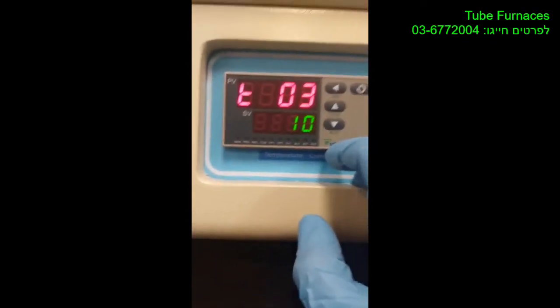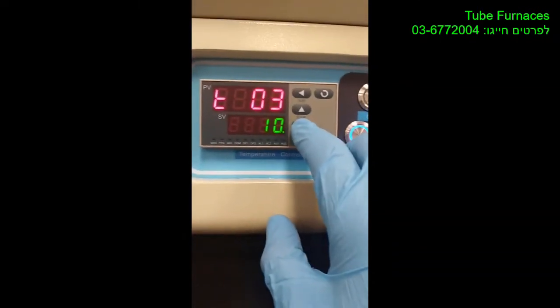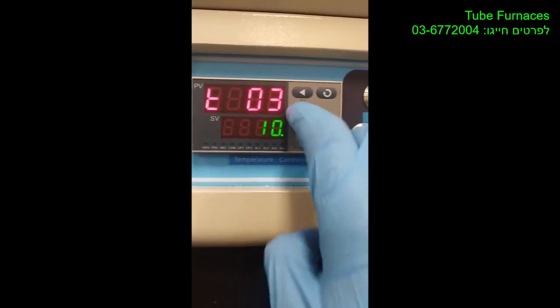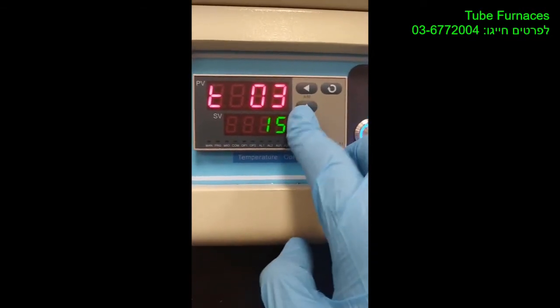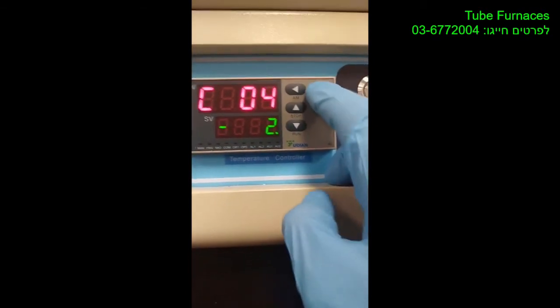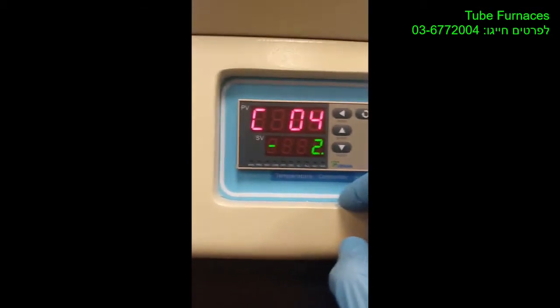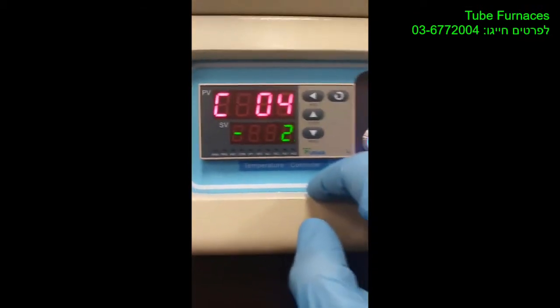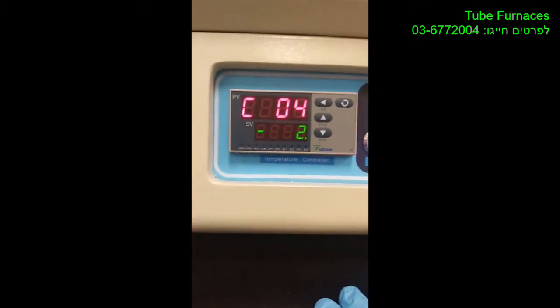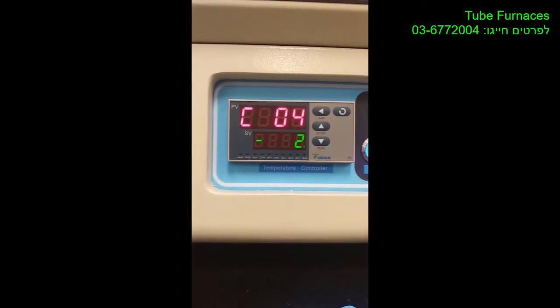Let's say we want it to cool down in like 15 minutes, which is not possible in this furnace, but let's say 15 minutes, and the temperature to get to, let's say negative something, like a negative arbitrary value. That means that you want the furnace to cool down, and just wait for it until the stop word appears on the LCD.